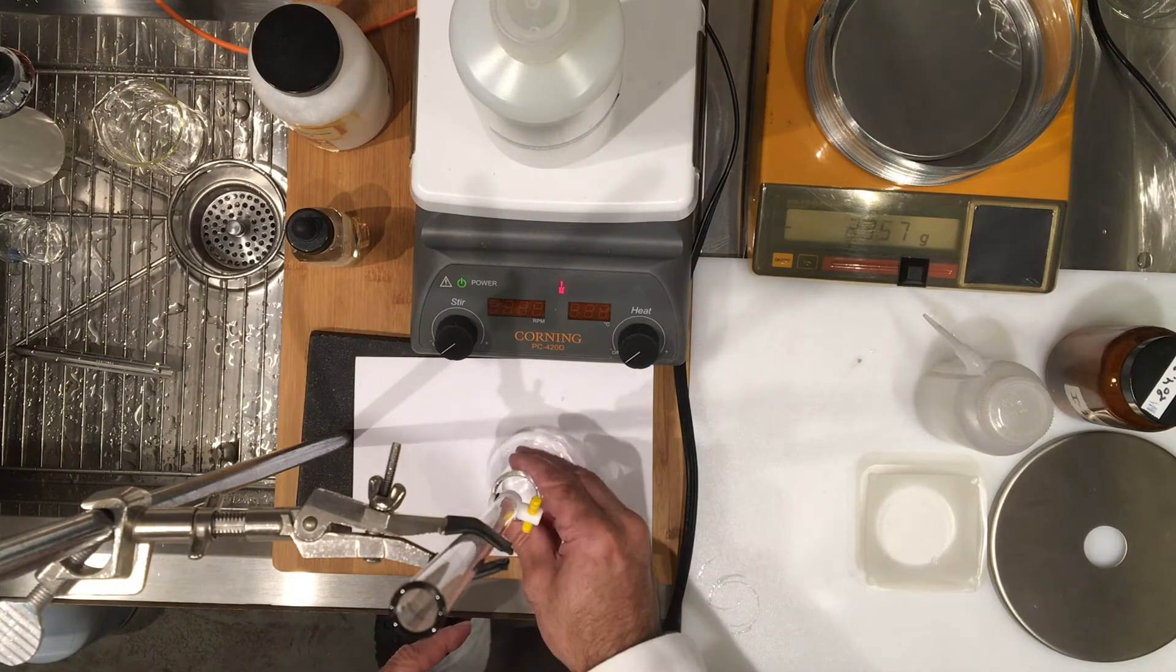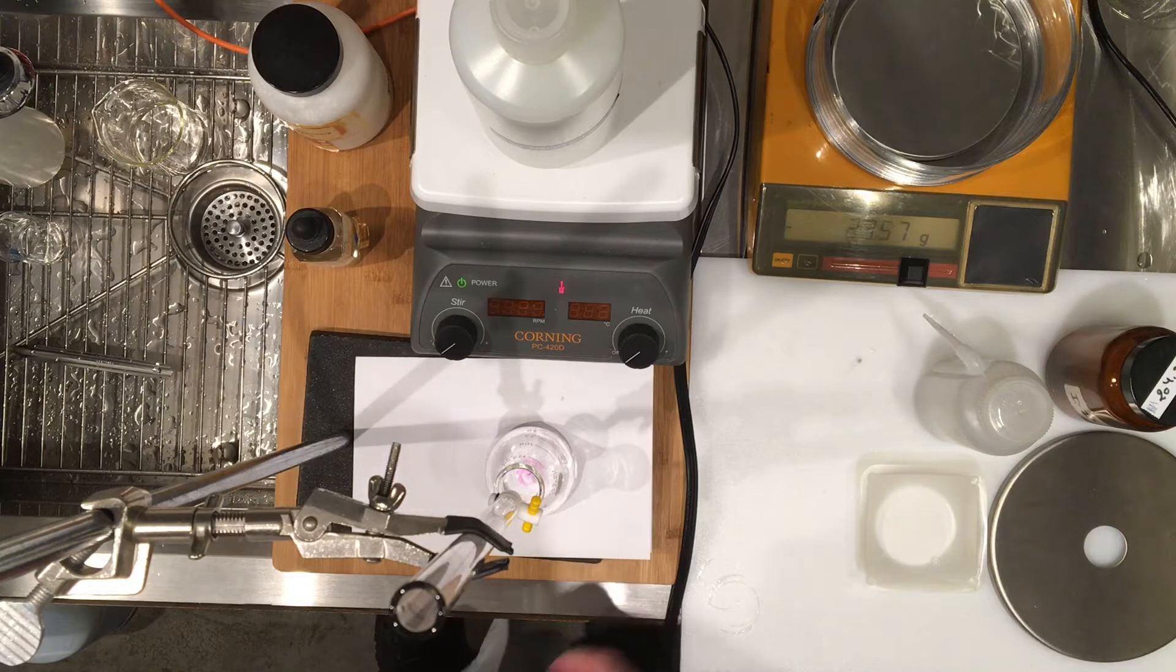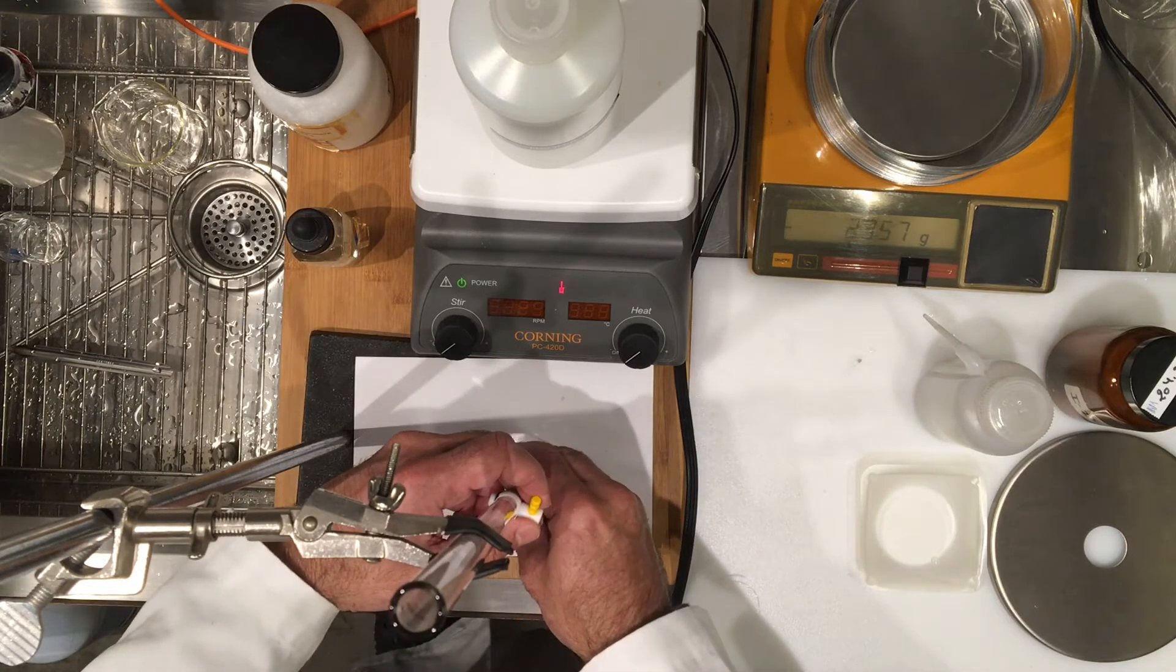Okay, so I'm really close now. Notice how the color changes with one drop. Here's one drop added and it turns into pink. You can now see every drop that falls. Here's another drop. The pink tends to stay longer so I know I'm close.